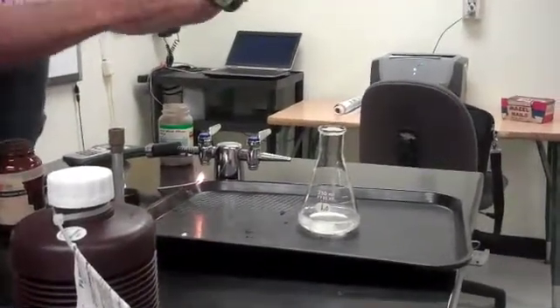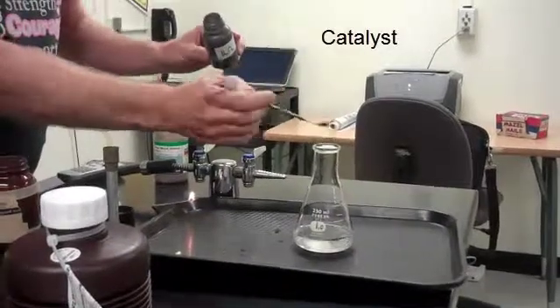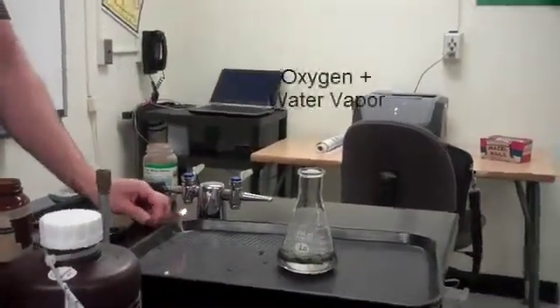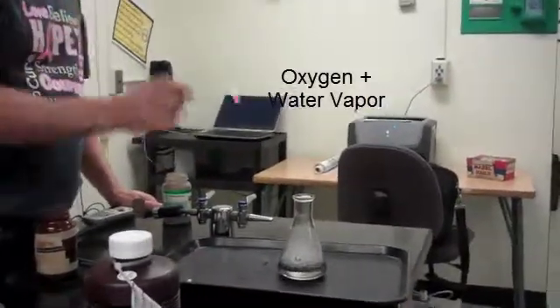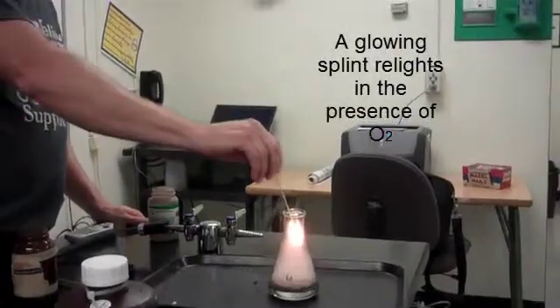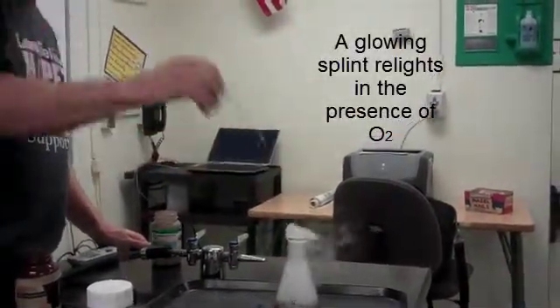I'm going to add the catalyst, the manganese 4 oxide. And we'll test for the presence of oxygen. So you can see plenty of oxygen is present.